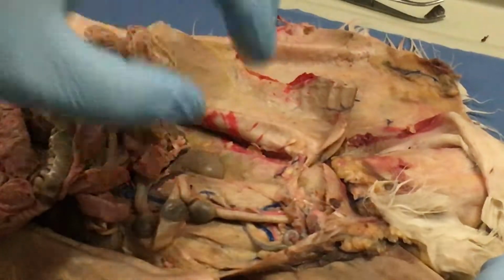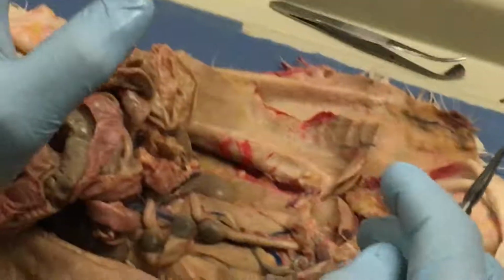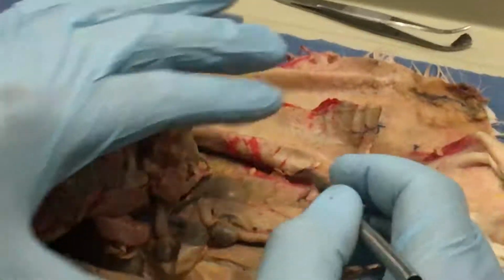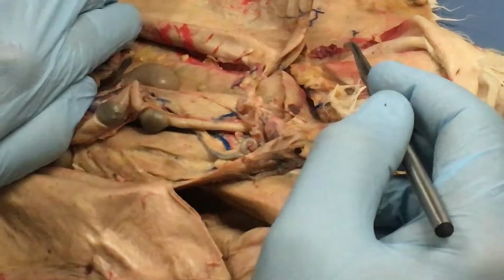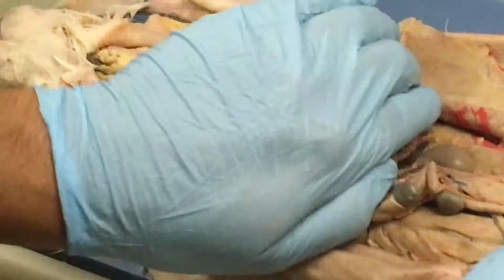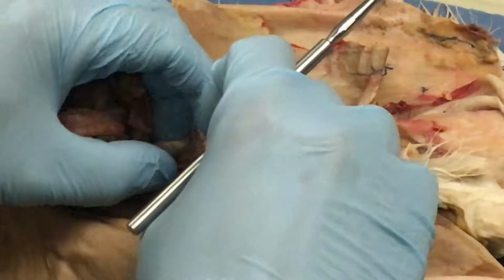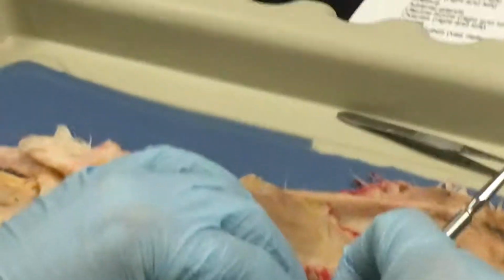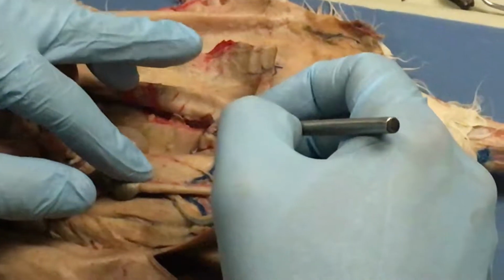In a normal female that's a mature female, or one that's had babies before, it looks like more intestine right here. But what I'm going to do is I'm going to pull all of this back. Okay, so you're not going to have to decide, is that uterine horn or is that intestine? I'm going to move the large intestine aside, and I'm going to make it very, very obvious that those are the uterine horns. Okay, at the end of each uterine horn, and it's really, really hard to tell on this.